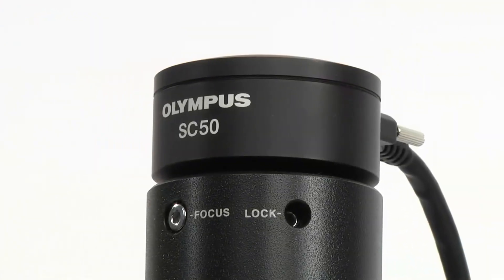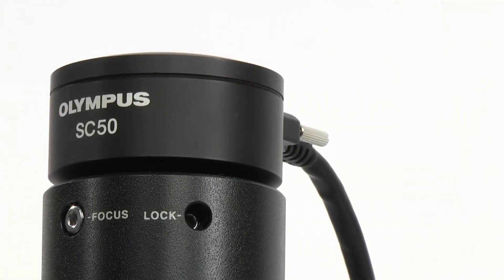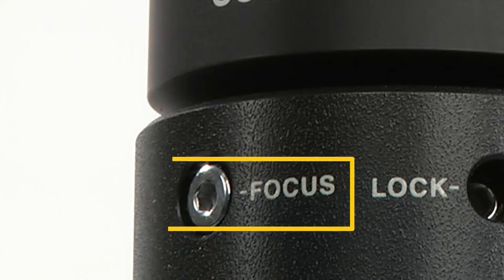For this procedure to work, the microscope should be equipped with a camera mount that has a built-in focus adjustment.